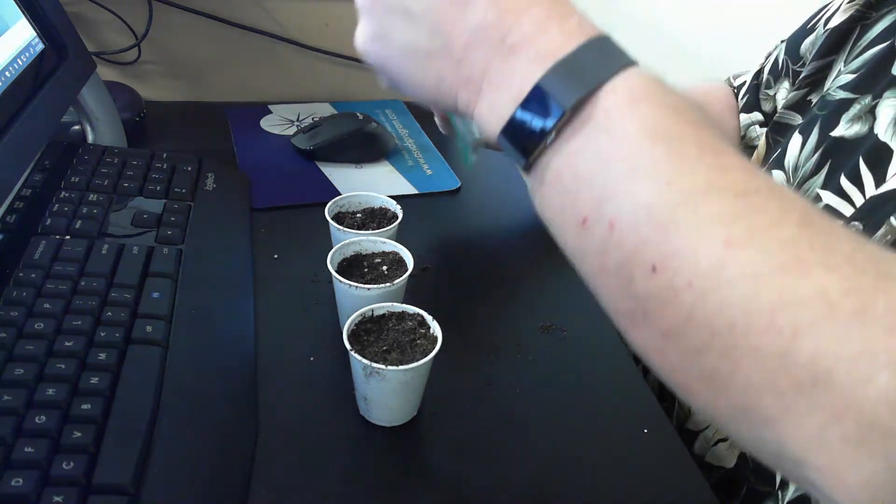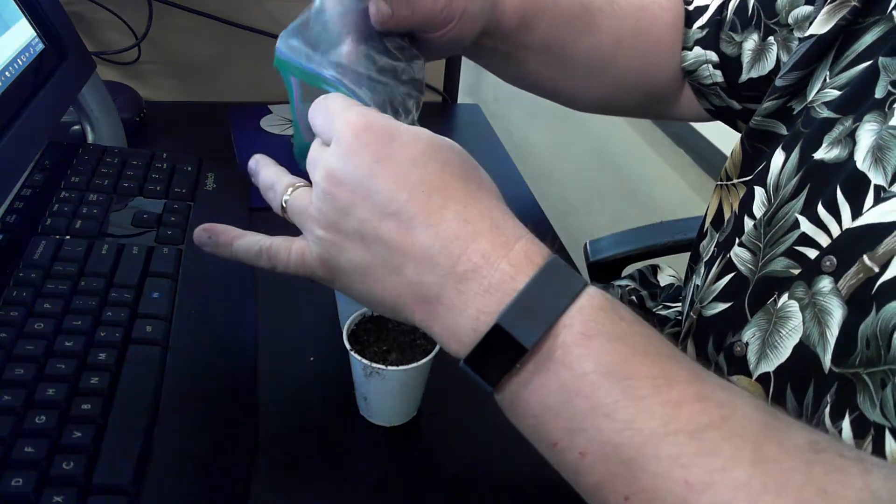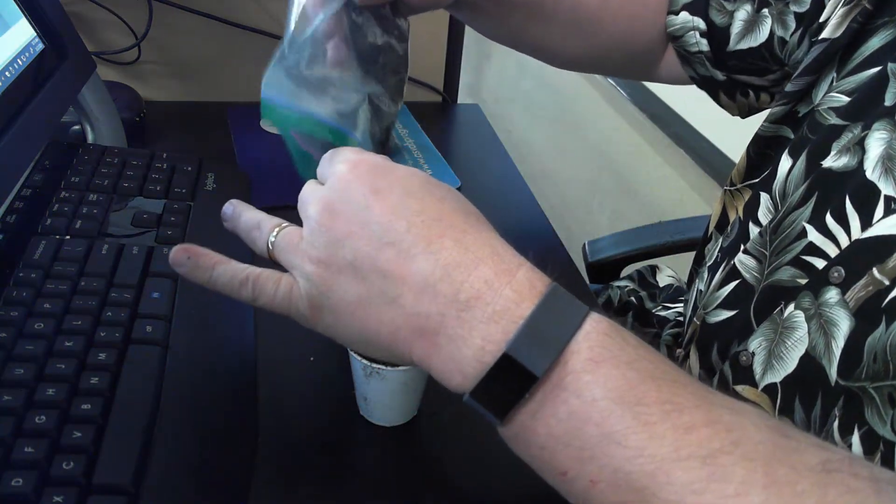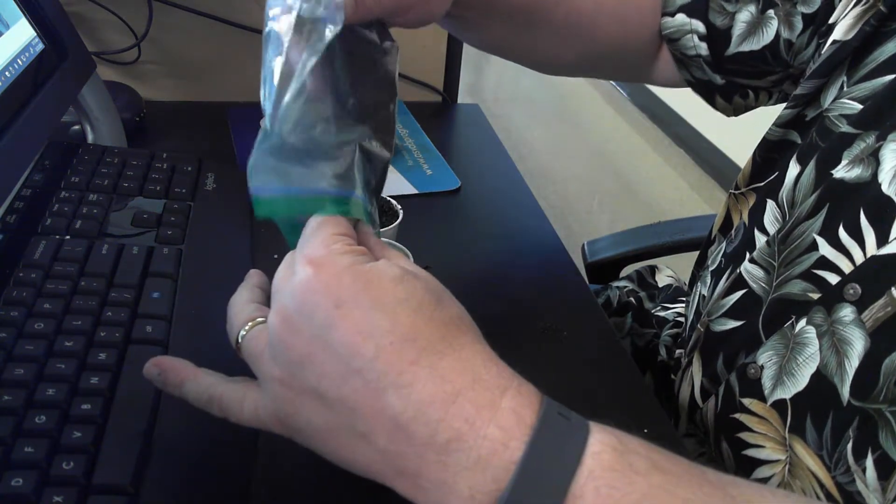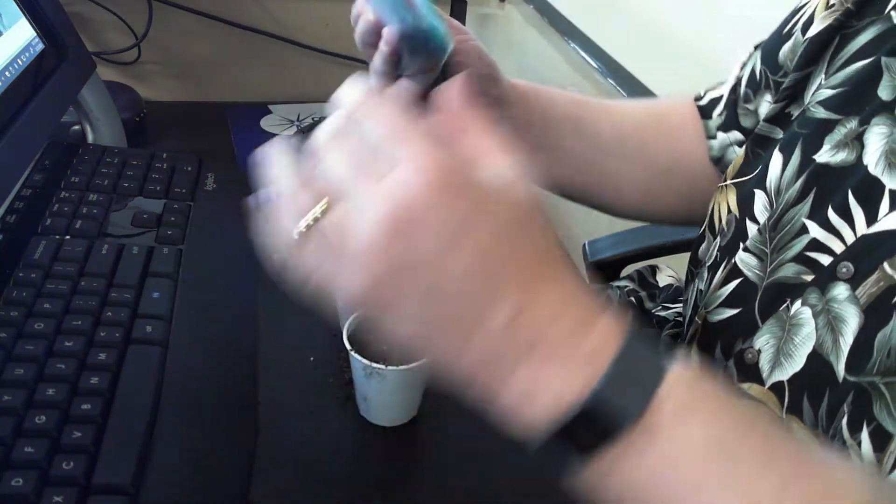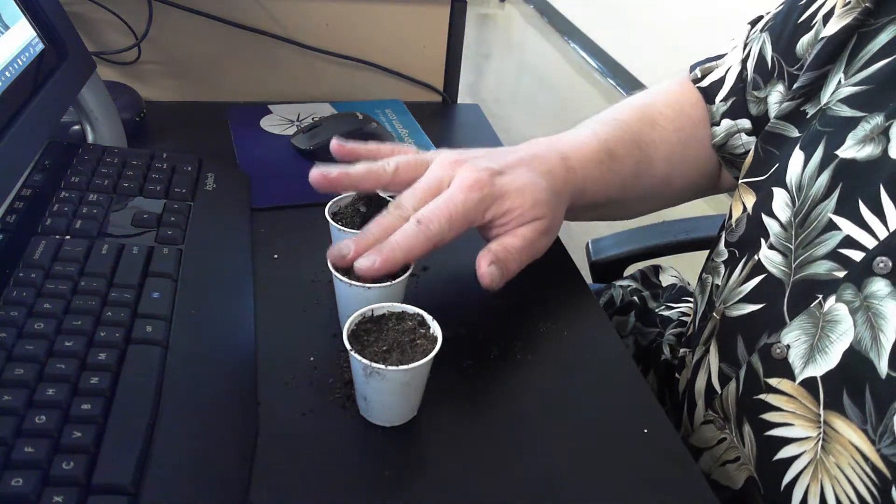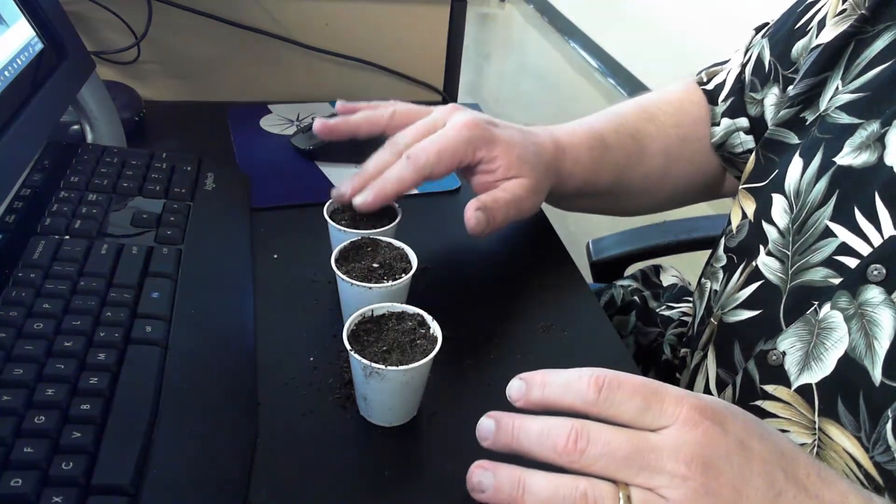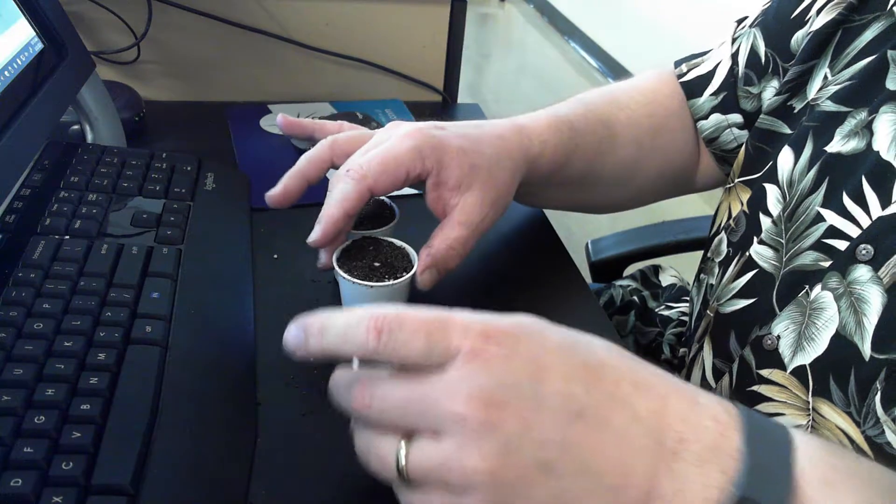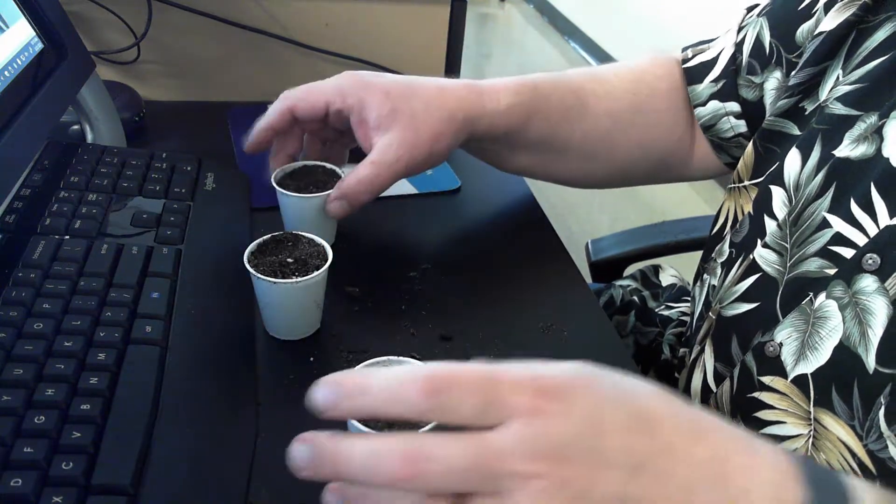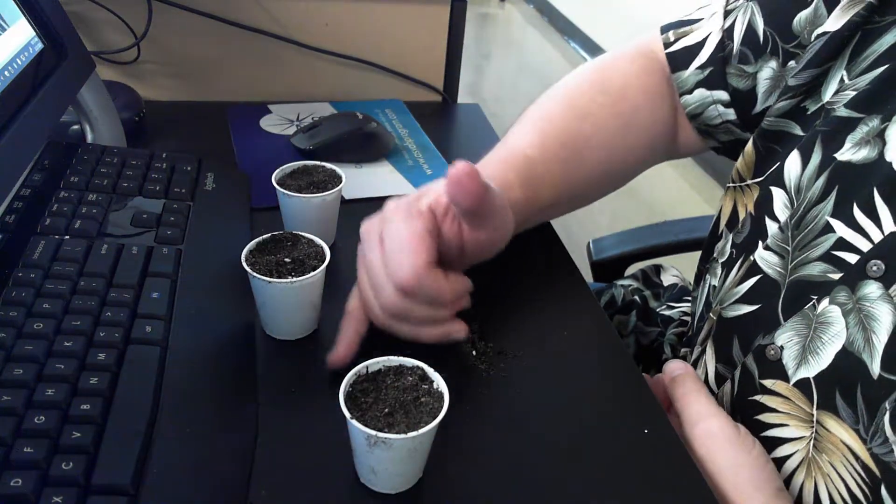You don't necessarily want it to be to the brim, but if you fill it to the brim and then press it down, you should be in pretty good shape.